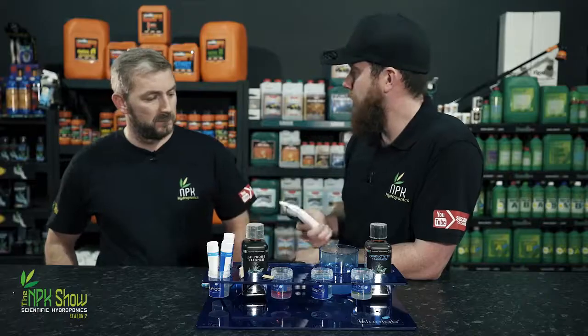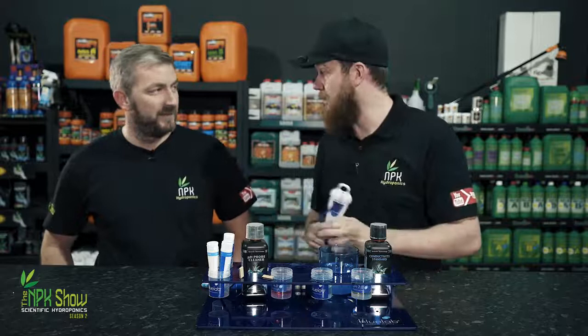If you do that once a month, so clean it, calibrate it, put the cap back on, you'll have it 48 months later. So that's basically pH pens done and dusted.